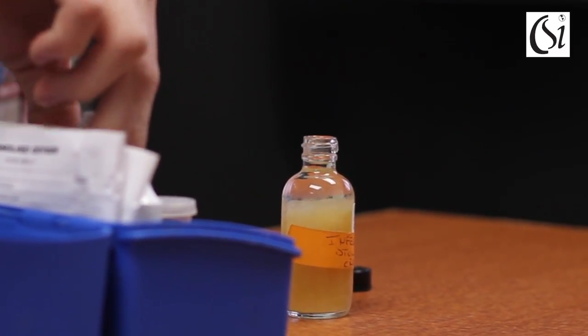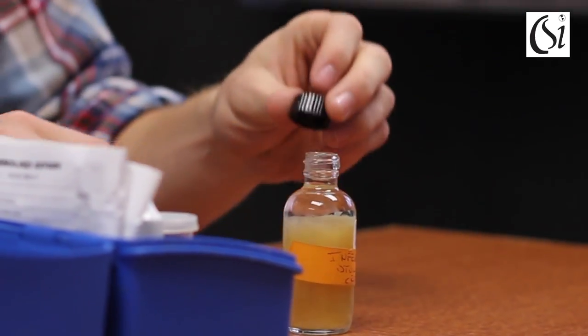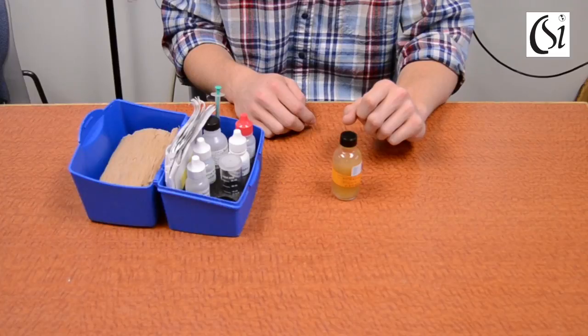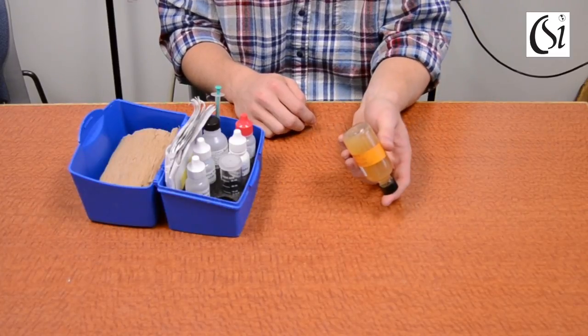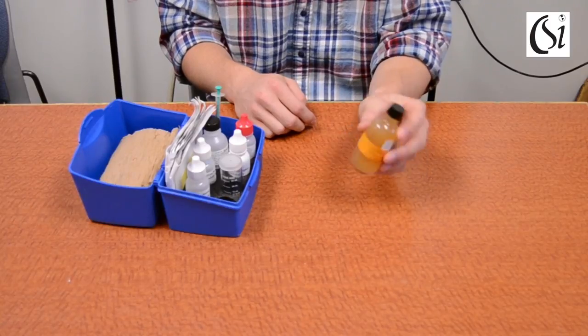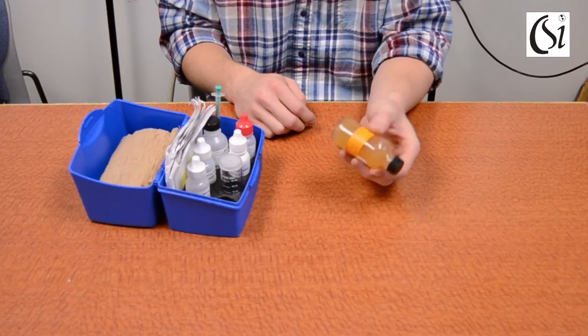At this point the sample has been fixed and the remainder of the test can be completed up to 8 hours later. Replace the cap and invert the bottle several times to mix the solution. Allow the precipitate to settle below the shoulder of the bottle before continuing.